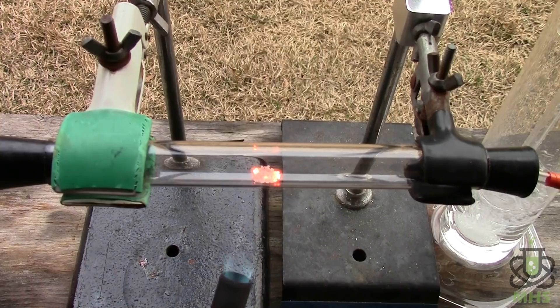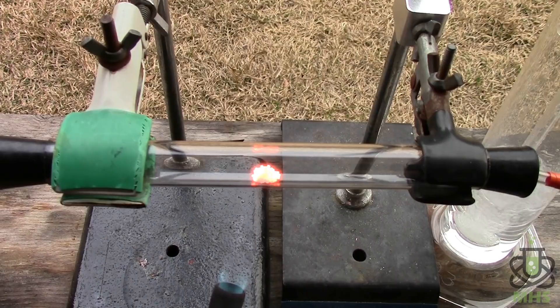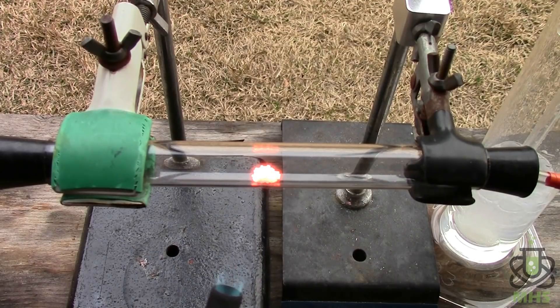Oh, it's beautiful. There's little bits of diamond kind of breaking off and sparking that hopefully you can see that as the oxygen passes over it.